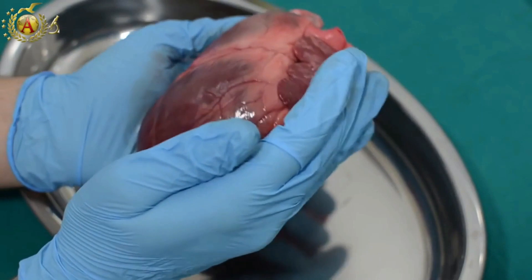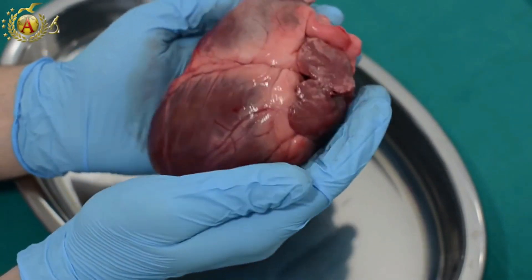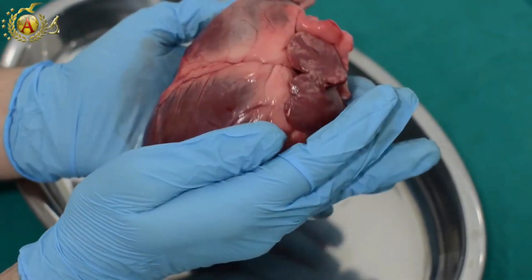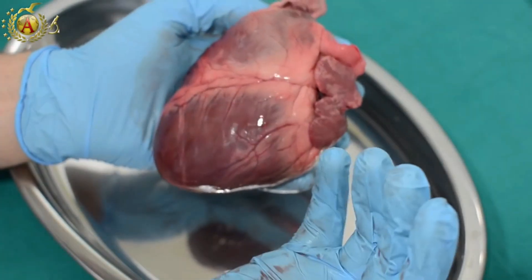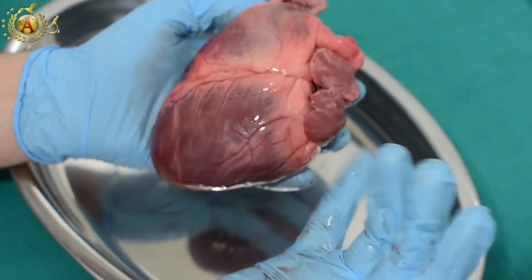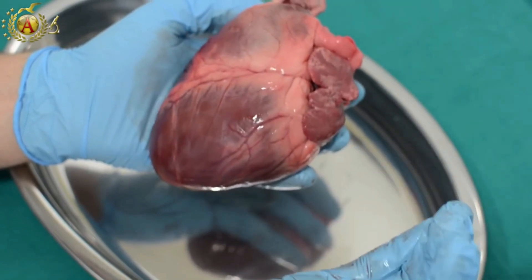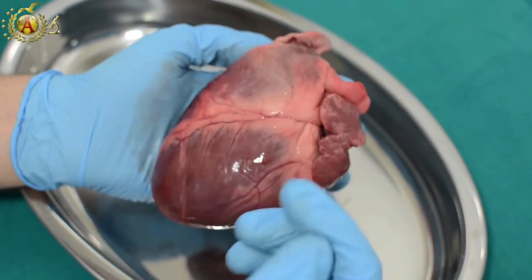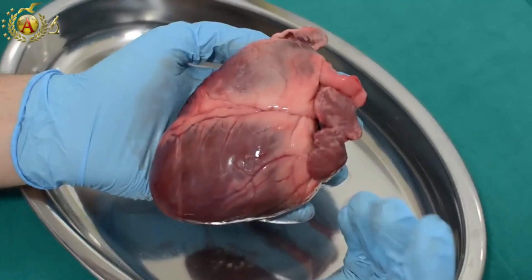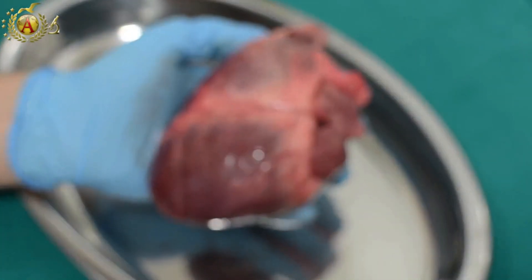Dissection of the Heart Anatomy — Cardiovascular System. In this video, we'll see something different. We'll analyze a real heart, not human, but swine.